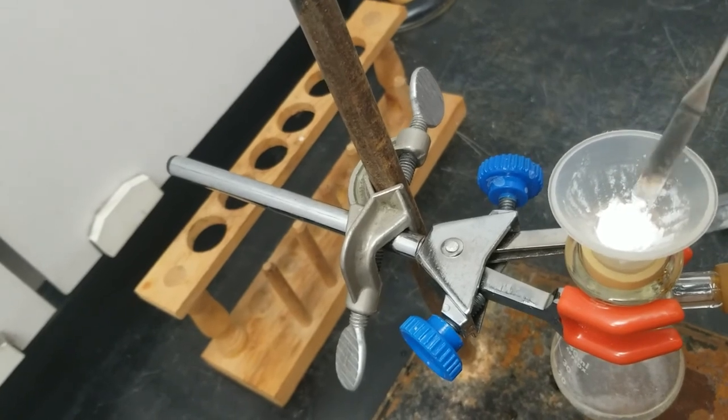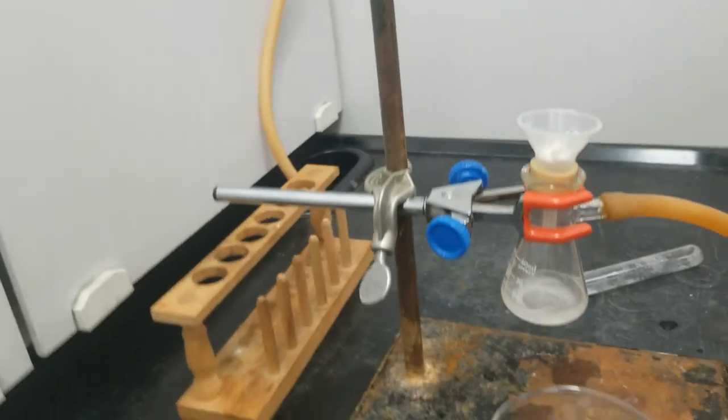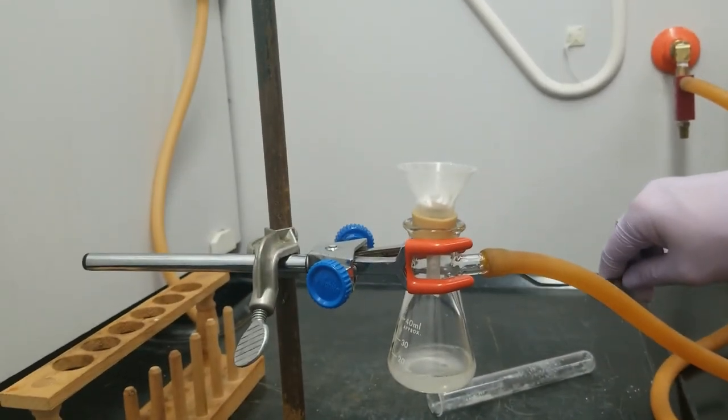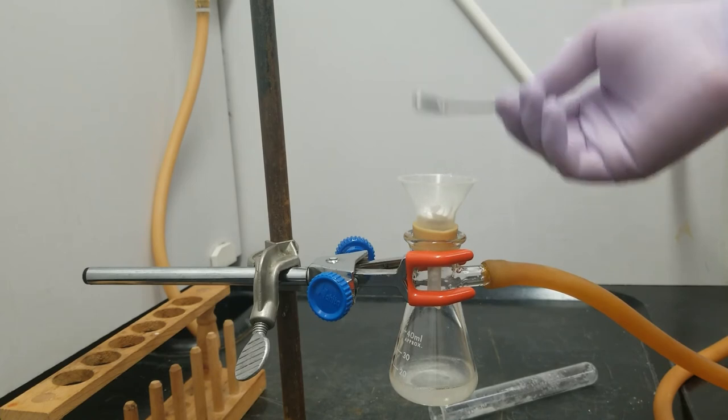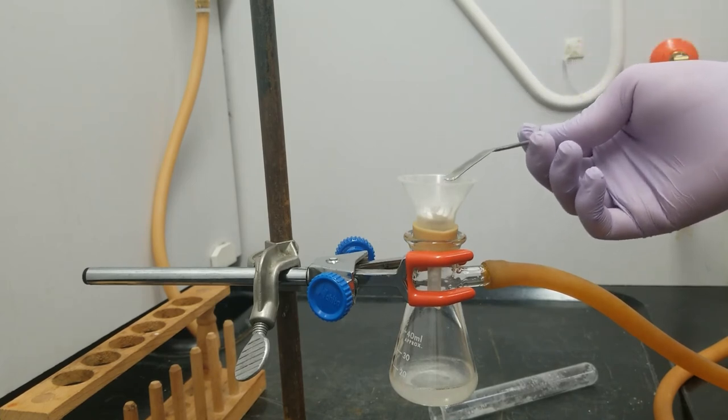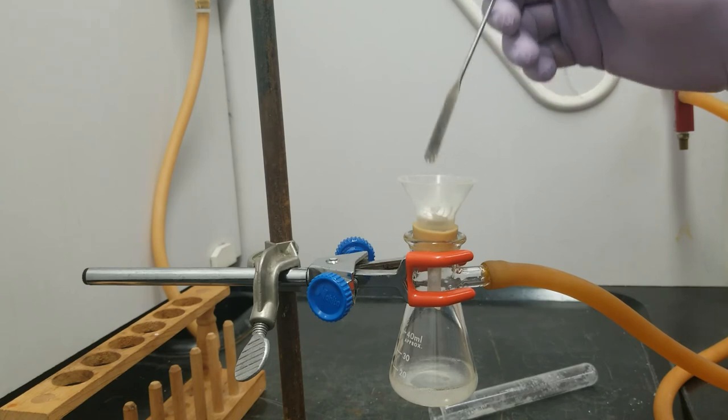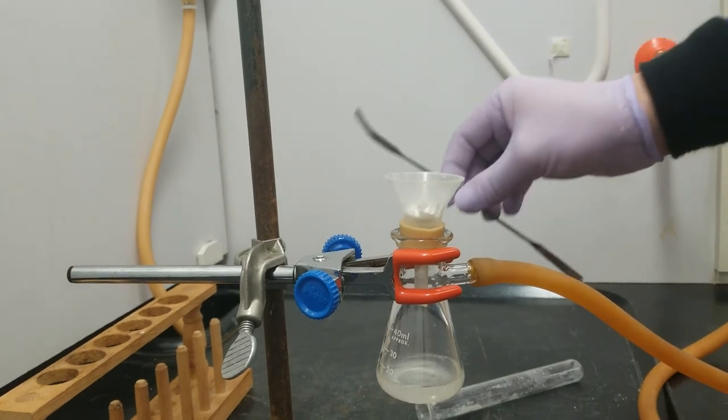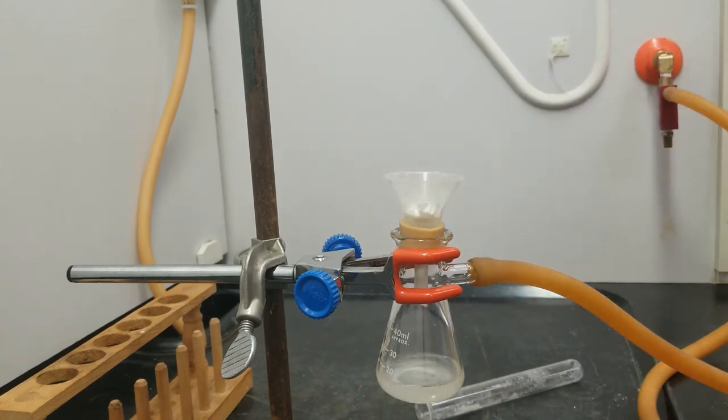Now, the good news is that the diphenyl methanol product, that's fairly non-polar. So it's weakly attracted to water and that makes it dry faster. The bad news is that water has a very low vapor pressure. So it's going to take longer than other solvents to dry. So with those two effects in combination, this is going to take about 10 or 15 minutes.